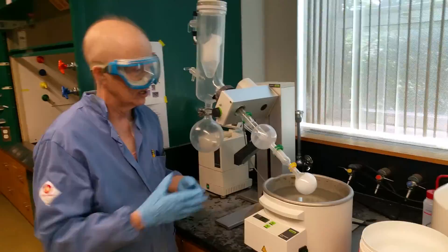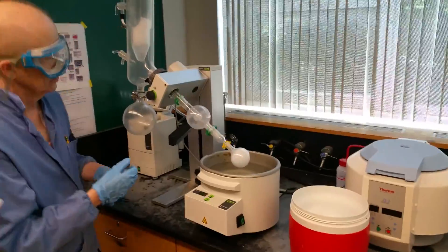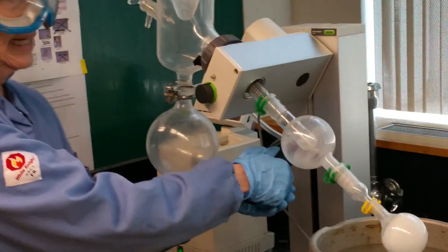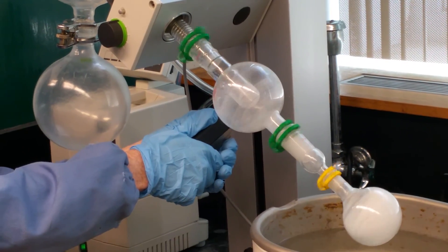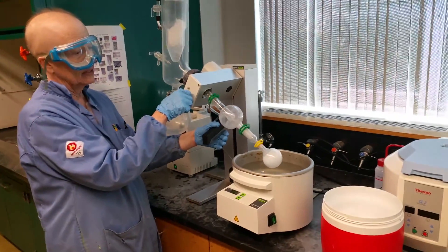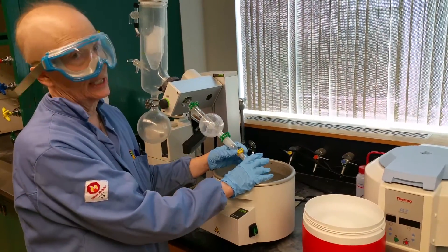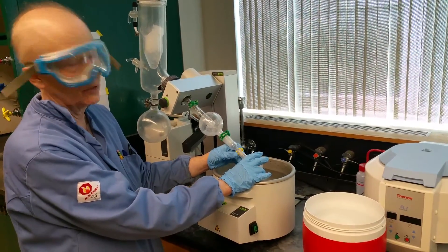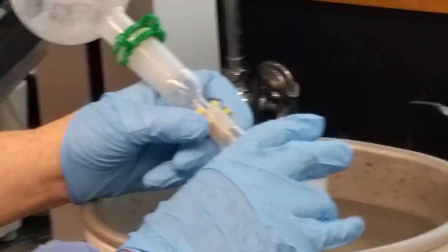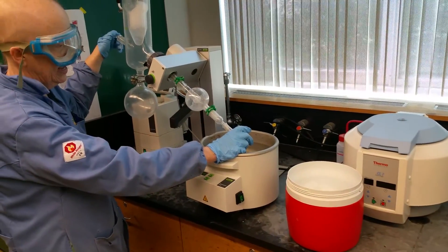This is done, I think. How do I know it's done? It looks really dry. So what I'm going to do is take it off. How do I take it off? I lifted it out of the water. If it's in the water, lift it out. You have to squeeze the lever to lift it out, and some people have trouble with this. If you have trouble, just ask for help. Then I turn the rotor off and stop it. And it should look like a solid shell when you're done. We're going to use these a lot.